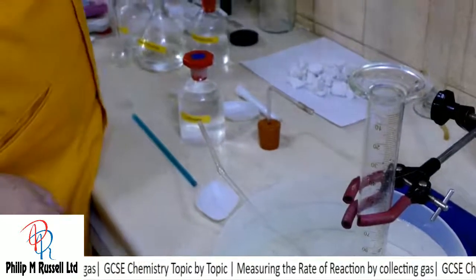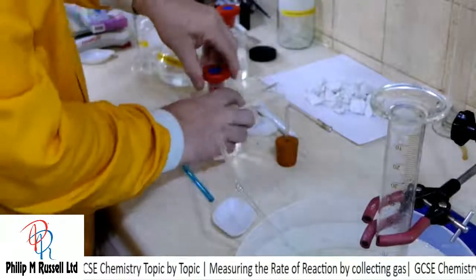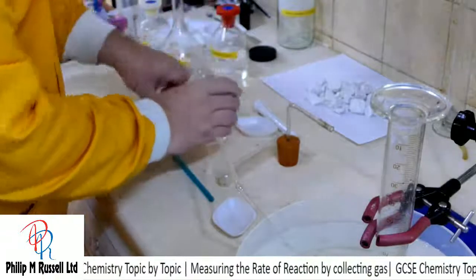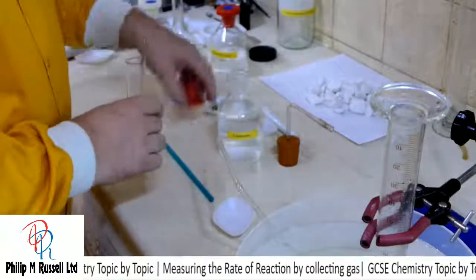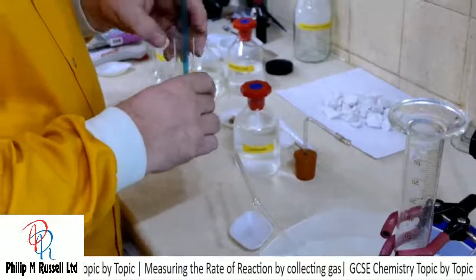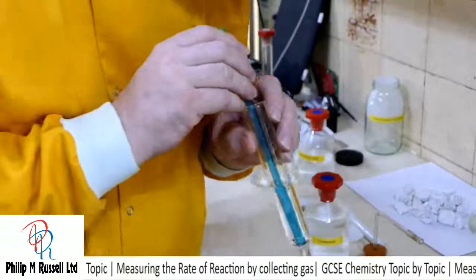Let's get out the boiling tube, and into this boiling tube I'm going to put some lime water. After last week I did repeat this experiment and it worked. I haven't tried it since, so it may work or it may not. Lime water in here, and what I'm going to do is just blow in here very gently.